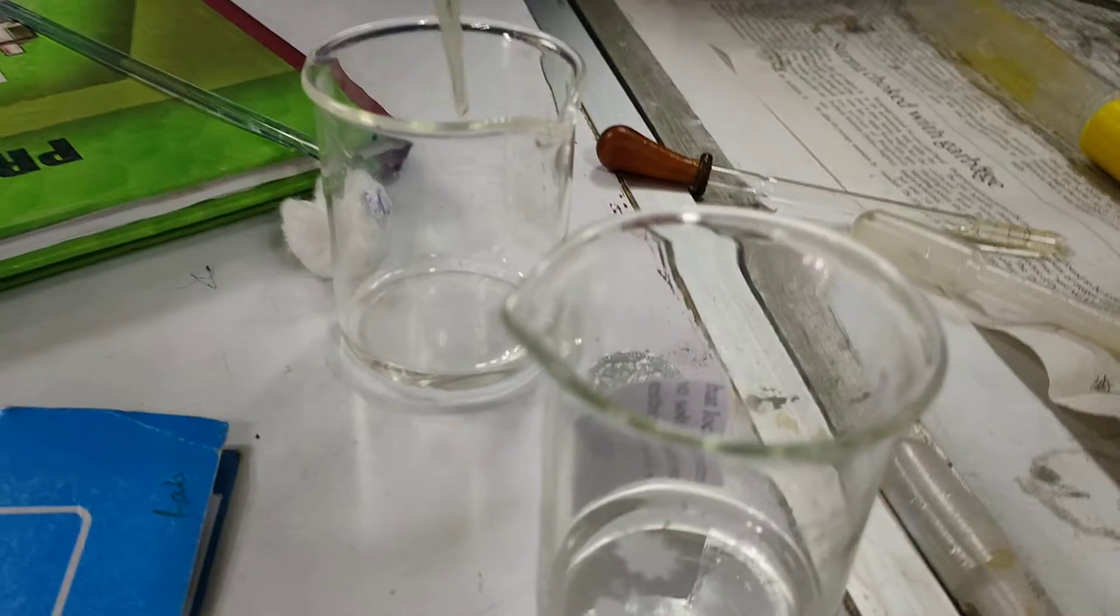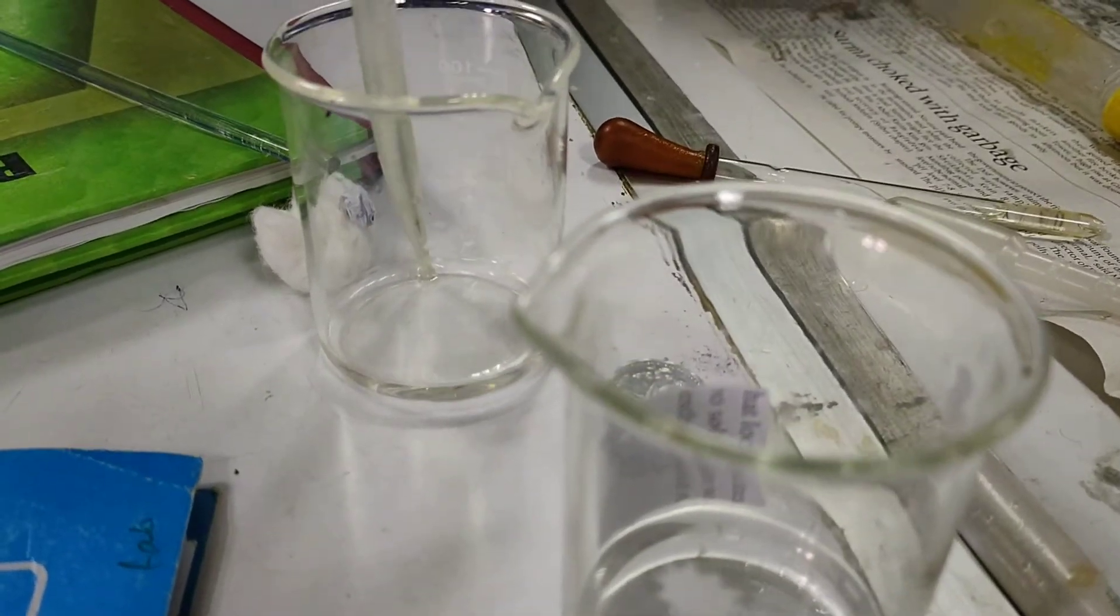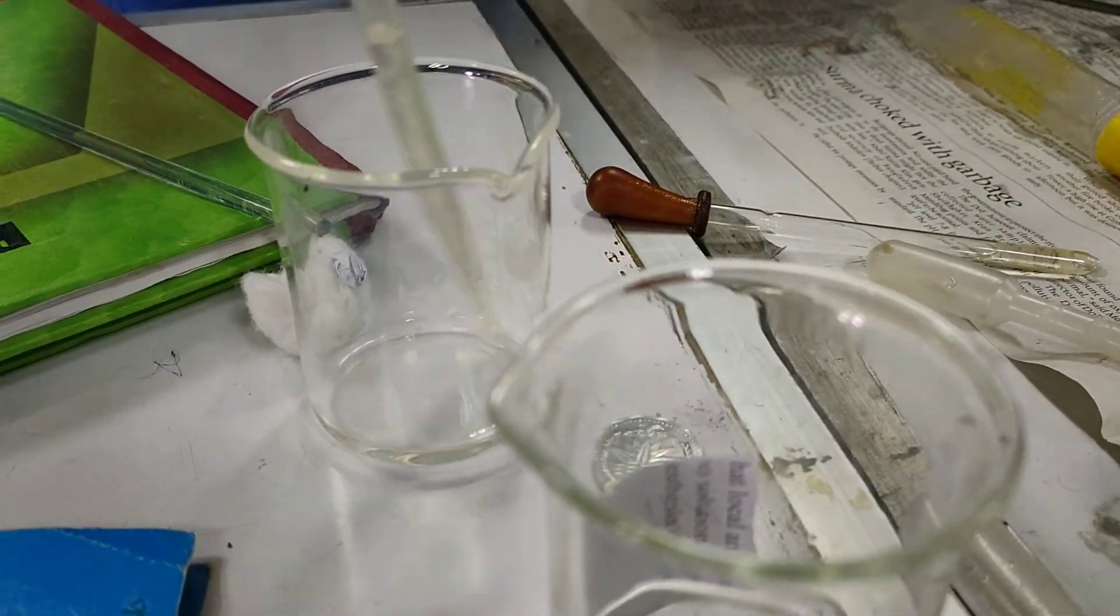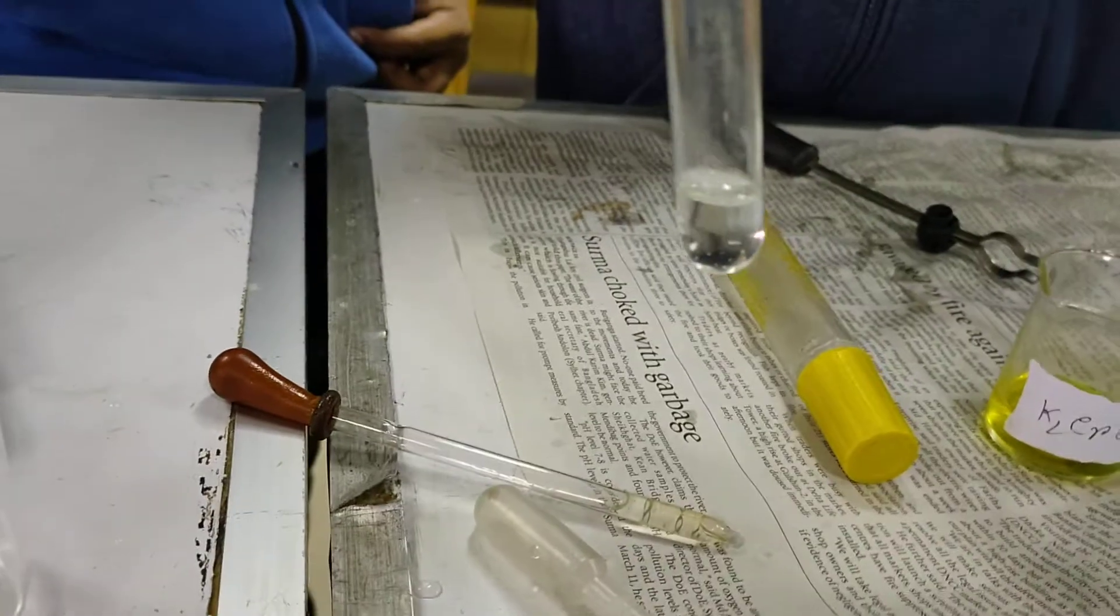Into this solution, we are going to add 3 milliliters sodium hydroxide solution. This is concentrated sodium hydroxide solution into this test tube.